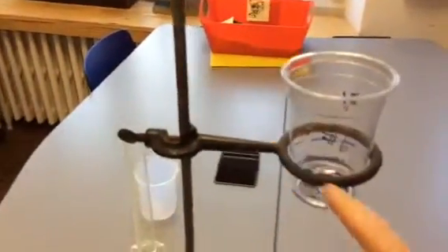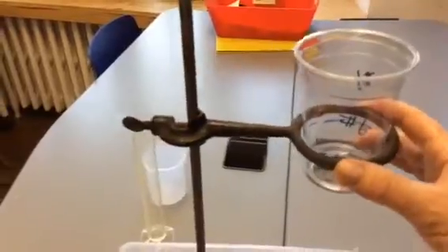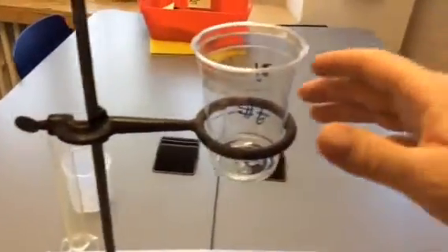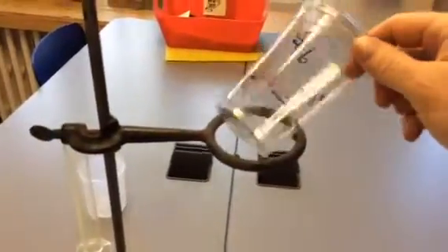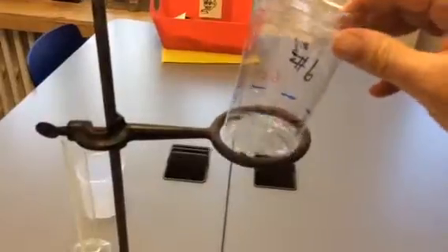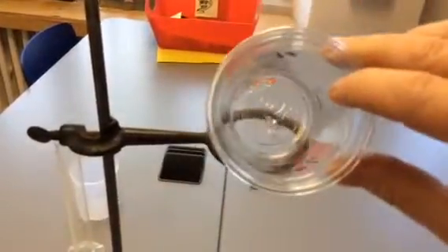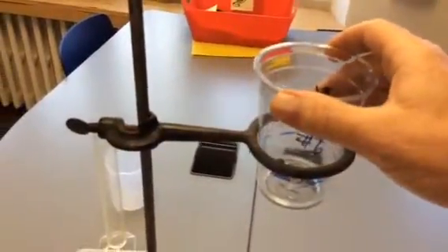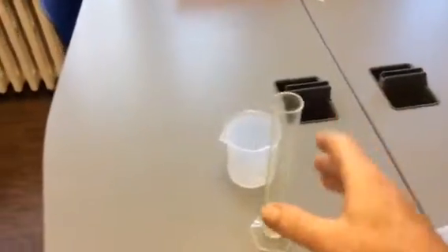Probably a couple new items here. One is this ring. It's literally called a ring. And then what it's on, this stand here, is called a retort stand. So this is a retort stand with the ring attached to it. Now every group is going to get a cup that I've already pre-made for you. It's a plastic cup, and then there's a small opening in the bottom of the cup for our fluid, in this case vegetable oil, to flow through. There's a spare graduated cylinder, and then another beaker that you're going to need for getting your samples of oil.